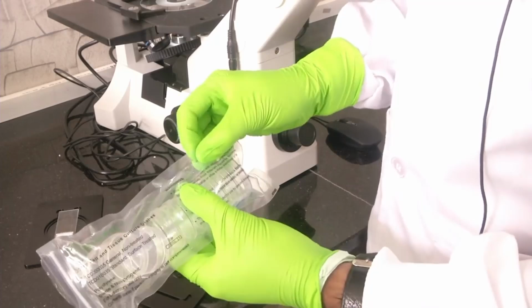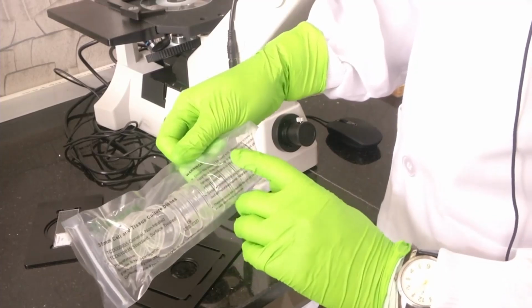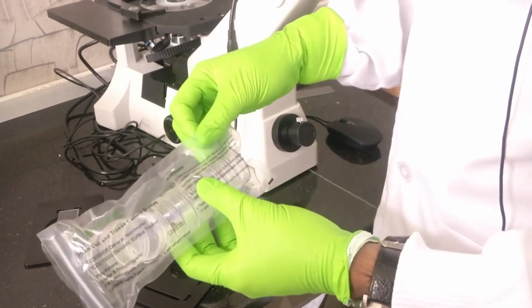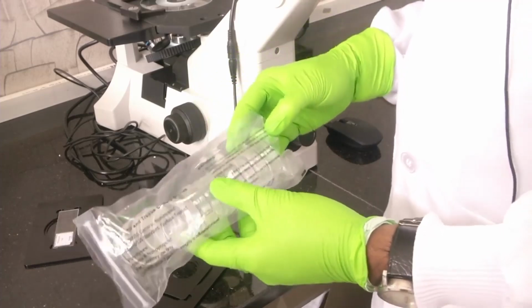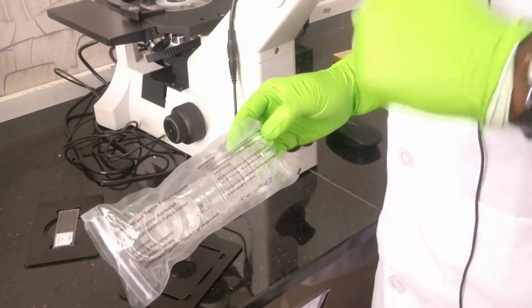So they have provided some warnings in this. Let's just run through these warnings. So what are the warnings they have provided? What they have written is, should this product be used with infectious or otherwise hazardous materials, those materials should be rendered harmless by sterilization or other suitable treatment prior to product disposal. See, they are taking care of downstream processes also, or at least they are warning us about downstream processes.